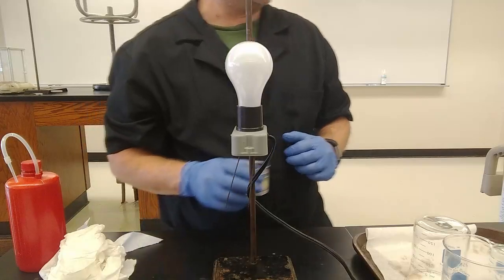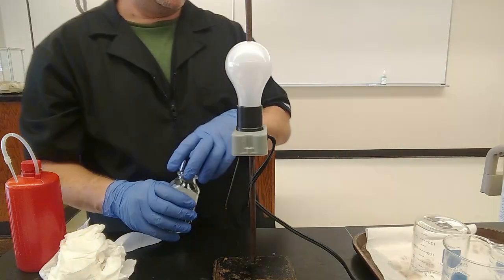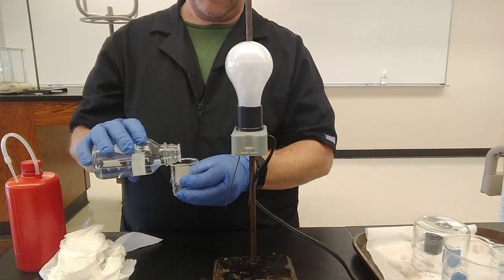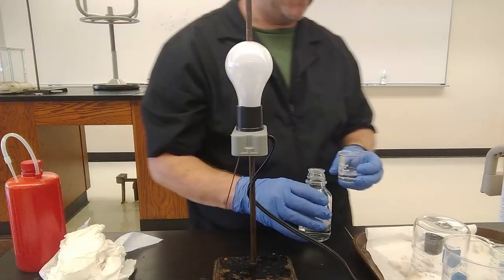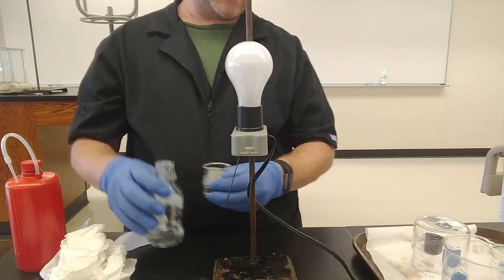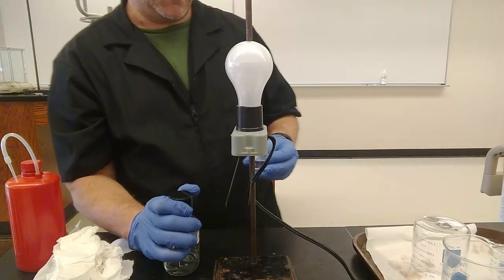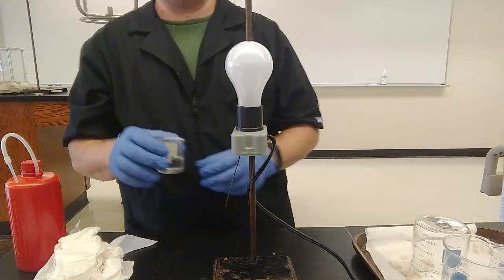Right, glacial acetic acid. It's a weird, very concentrated but weak acid. There are only 6 strong acids. HCl, HBr, HI, those 6. Oops, I wanted to put this in a big beaker. I'll start it with it in a small one, why not? HCl, HBr, and HI. Nitric acid, HNO3. Perchloric acid, HClO4. And sulfuric acid, H2SO4. But only the first H counts for the strong acid. So this is a weak acid.